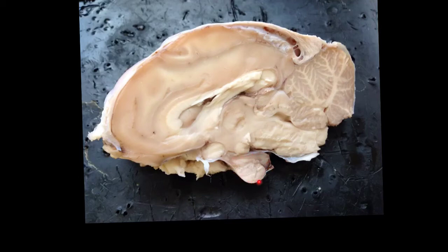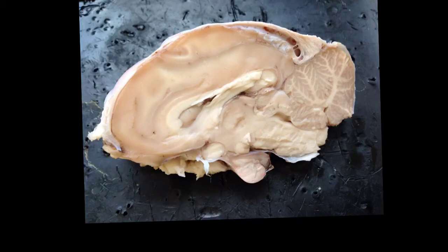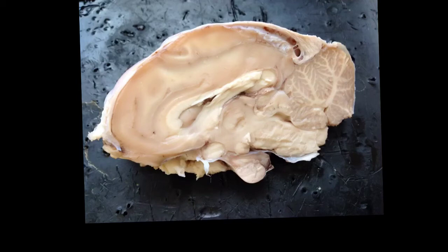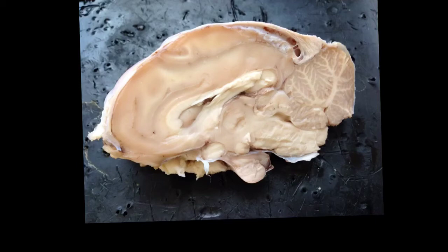You may or may not have seen the pituitary gland on your own sheep brain dissection. A lot of times this large pituitary gland, which is only connected by a structure called the infundibulum, gets ripped straight out — because that pituitary gland sits in its own little seat called the sella turcica within the skull.